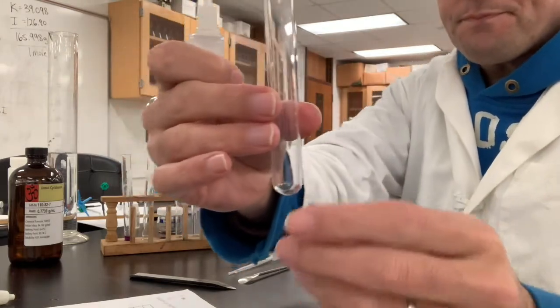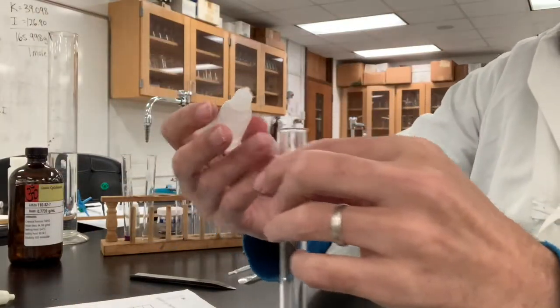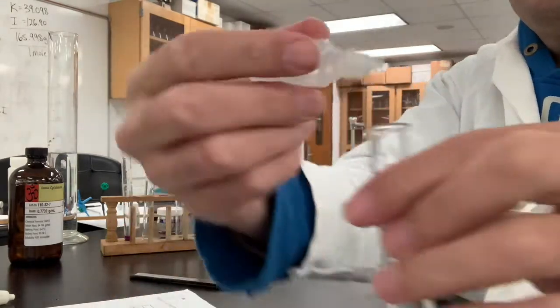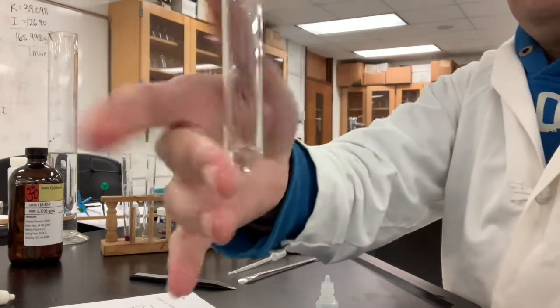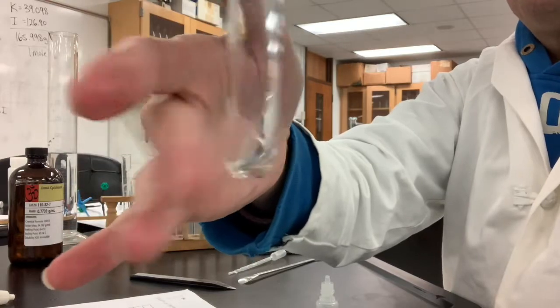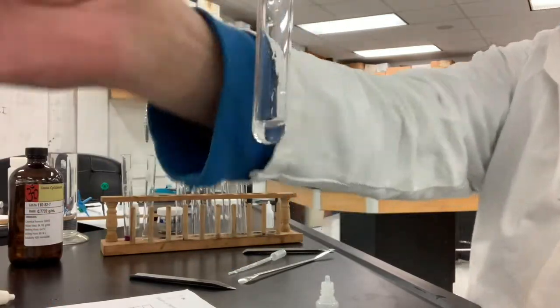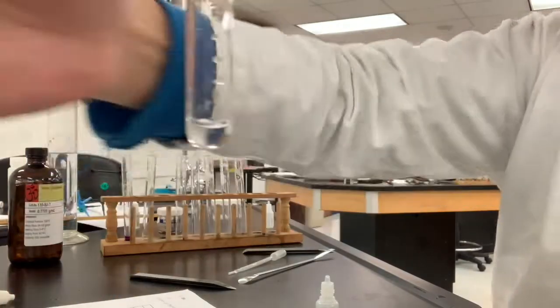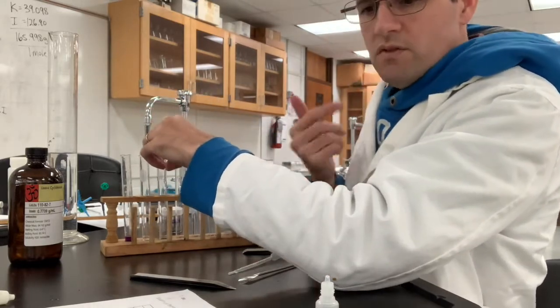Here's iodine — you're not able to see it, it's just such a small little speck in there. You can't see it on the camera. Let's add some water — put a milliliter in there and we will see what happens. That's iodine in water. Iodine is diatomic, it has the formula I₂, and it's here in the lab.